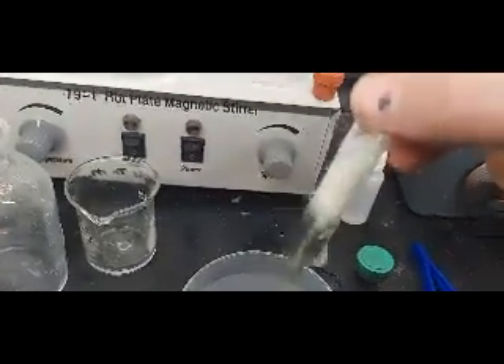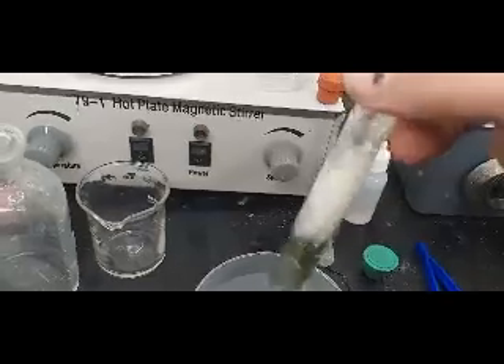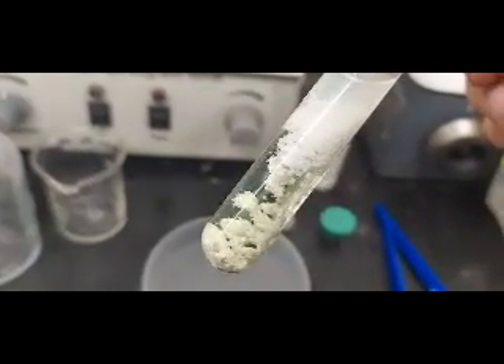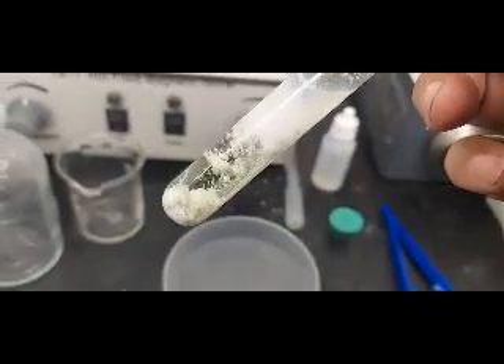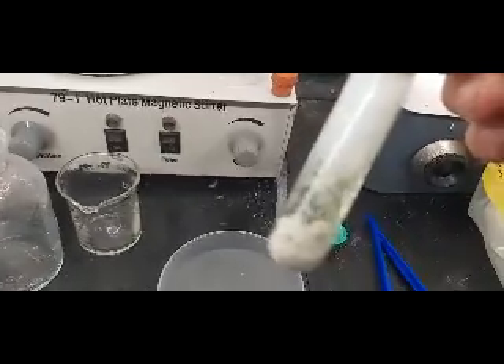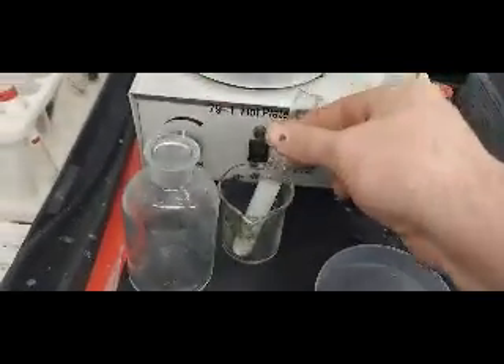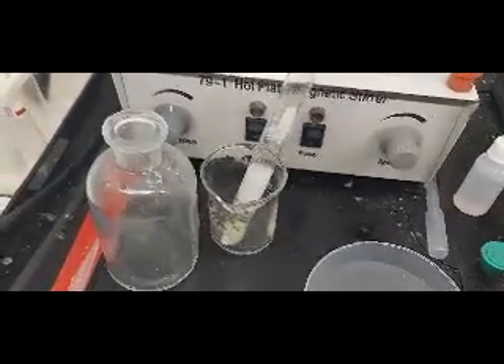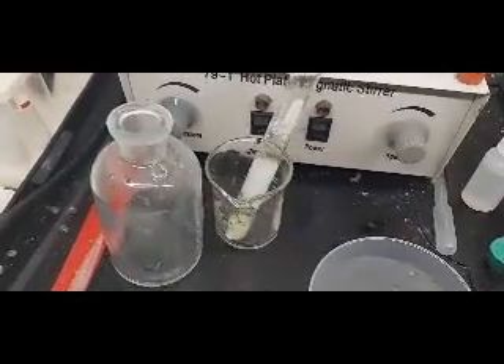Those are silver chloride — it makes a big mess, but it is neat to look at. You can see the heavy silver chloride precipitate. That's double confirmation that it was 95% silver. There you go — the nitric-after-cupelling test. You can call this a silver confirmation test if you want — it's confirmed.